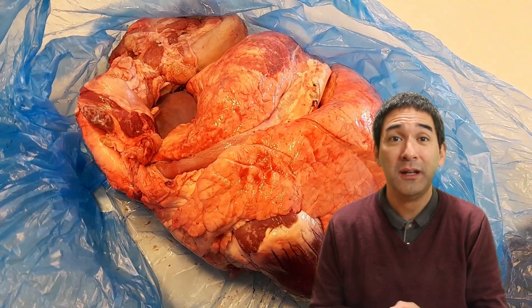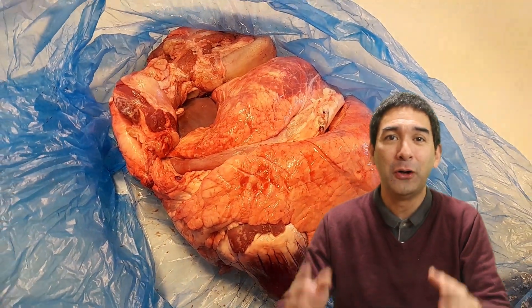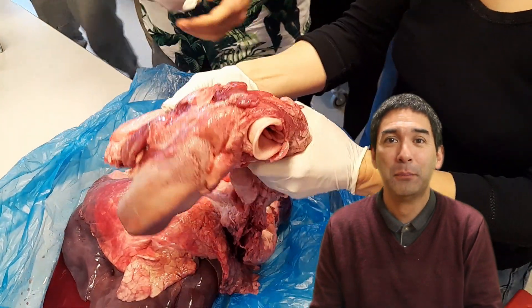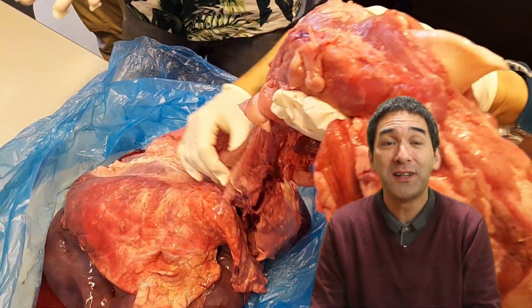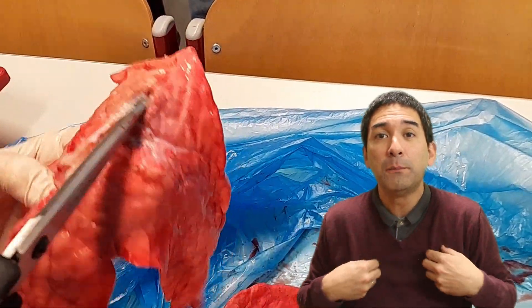Now for the background story on the pig's lung dissection. One of my students has a connection to a local butcher, and I asked if she could order some lungs for school. What we got were not only the lungs but also the windpipe, the heart, the liver, and some other organs. The intestine was missing — I guess the butcher needed it to make sausages. Here we are dissecting the lungs by cutting along the bronchi, the air passages that carry air to the alveoli.